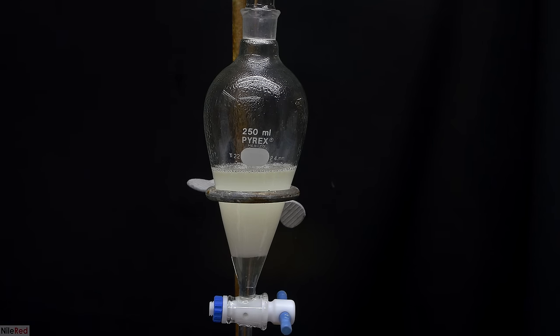The purpose of this distillation isn't to isolate our 1-octen-3-one, and it's simply to remove toluene and any much higher boiling point side products. With heating and vacuum on, we bring things to a boil, and we start to collect our first fraction, which is toluene. Our desired ketone fraction comes over between 60 and 85°C at a pressure of 15 millimeters of mercury. The temperature that our fraction comes over at though, is really dependent on the pressure, and my pressure is not 15 millimeters of mercury. My vacuum pulls at around 37 millimeters of mercury, so my fraction came over between 85 and 110°C.